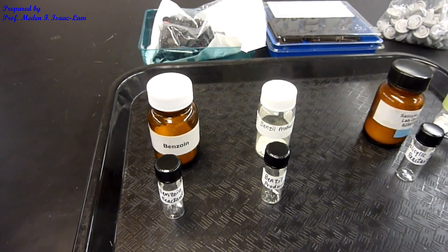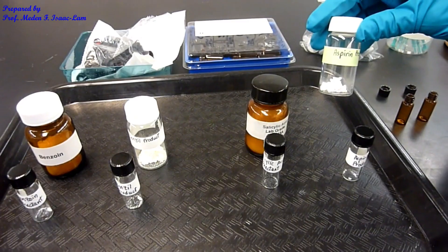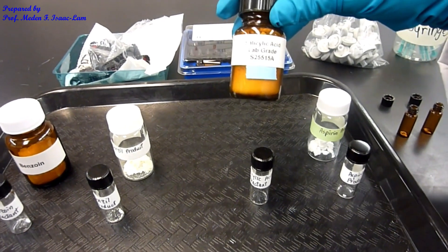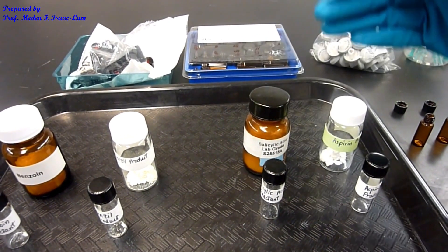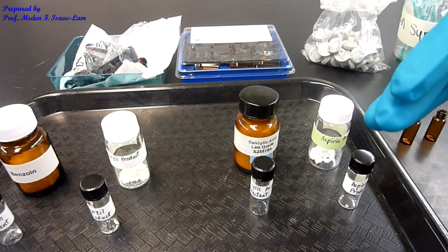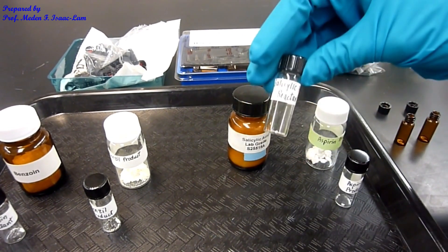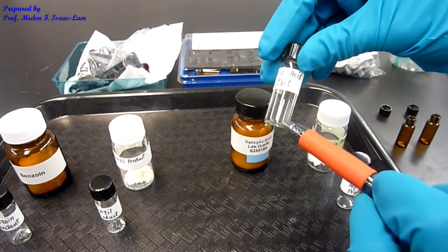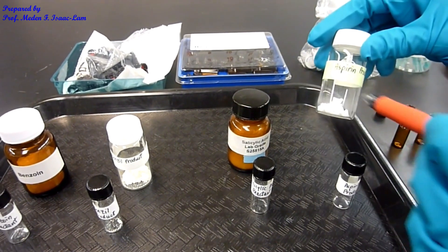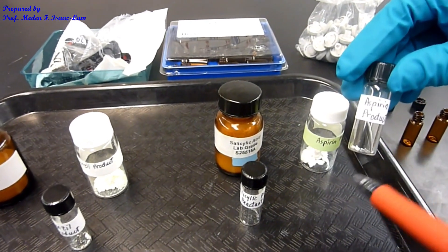Say for example you have another reaction, another synthesis. For example, you synthesize an aspirin product, and then your starting compound is salicylic acid. You will do the same thing to determine the purity of the product using HPLC. You are going to weigh the reactant — 2 milligrams — salicylic acid as the original reactant, and then the product, aspirin, also 2 milligrams.